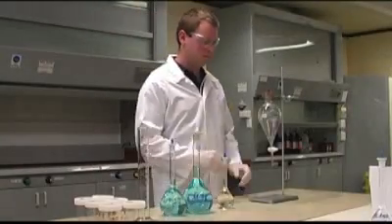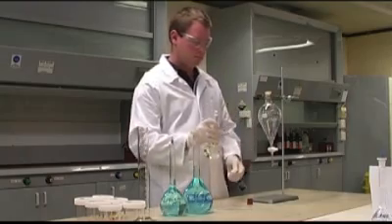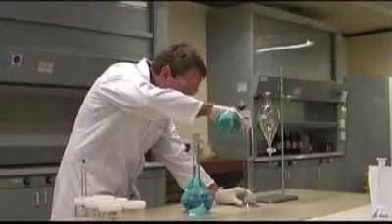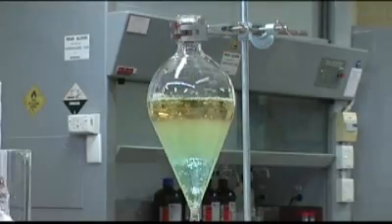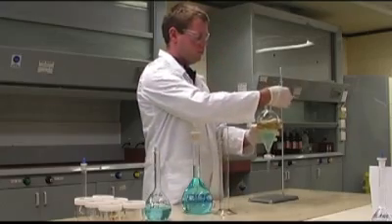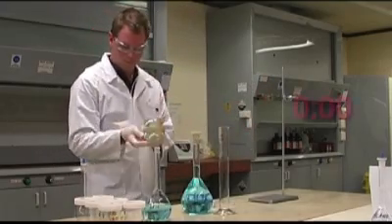What do we do first? Well, you need to begin with a prepared solvent extractant. 200 millilitres of this is placed in a separating funnel. Next, 200 millilitres of the copper sulfate leach solution — the blue stuff — is added. Then we insert the rubber stopper into the top of the separating funnel and shake the mixture vigorously for two whole minutes.